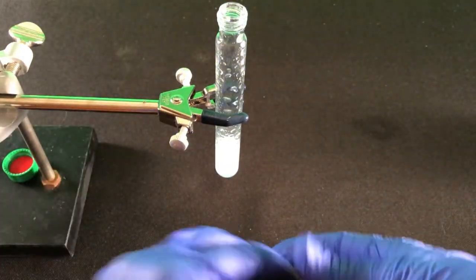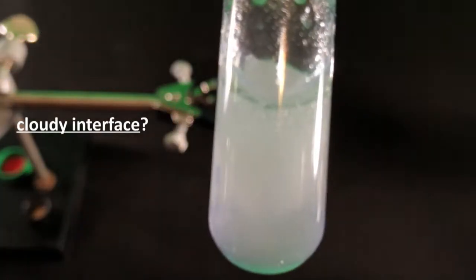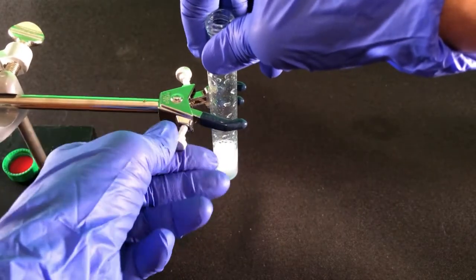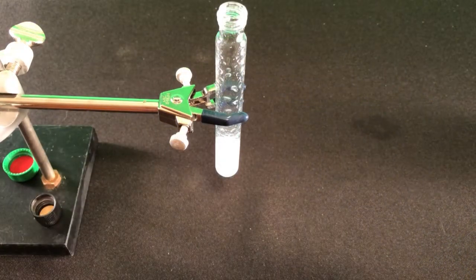However, things don't always go as planned, and sometimes a thick, cloudy layer, an emulsion, can form between the 2 solvent layers. An emulsion is a colloidal mixture of 2 solvents. This is often caused by impurities that are present or the slight solubility of water in some organic solvents. It can be hard and time-consuming to get rid of an emulsion. The easiest process is sitting and waiting for 2 clear layers to form.